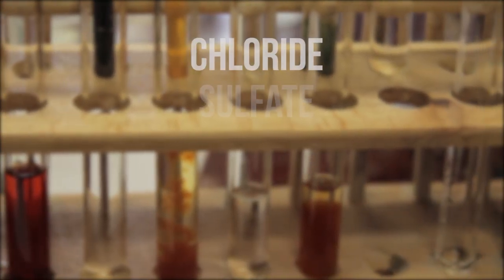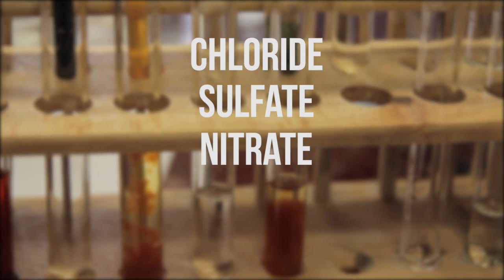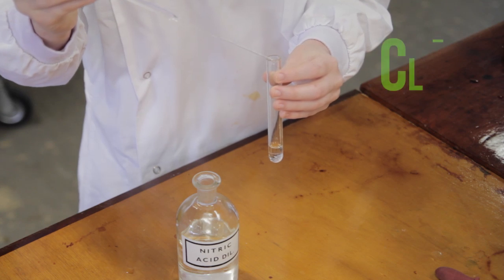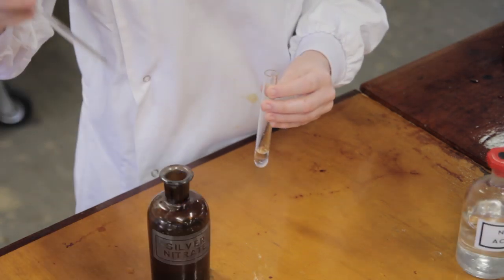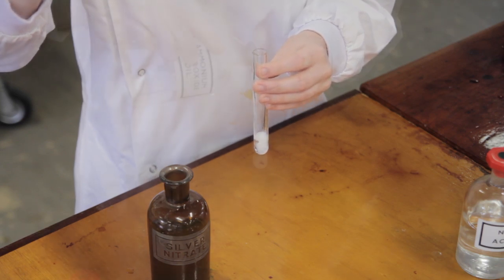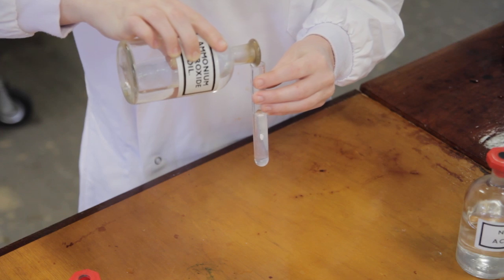The most common anions used in first year are chloride, sulfate, and nitrate. They are straightforward because you only need to carry out confirmatory tests for each. The chloride anion Cl- is acidified with diluted nitric acid and then reacted with silver nitrate solution. A white precipitate forms and can be dissolved in dilute ammonium hydroxide.